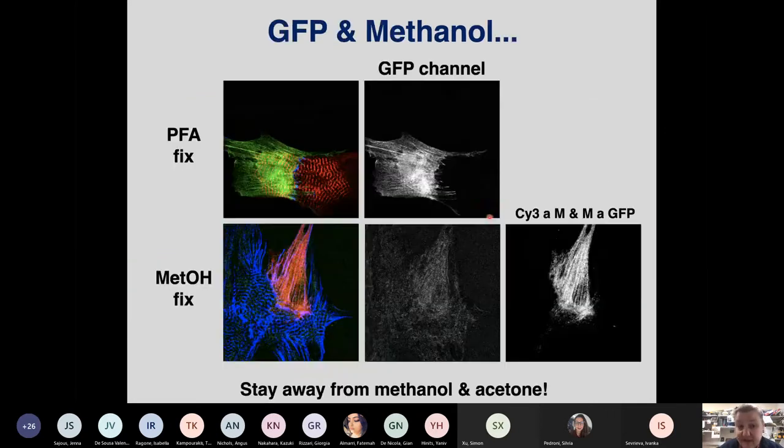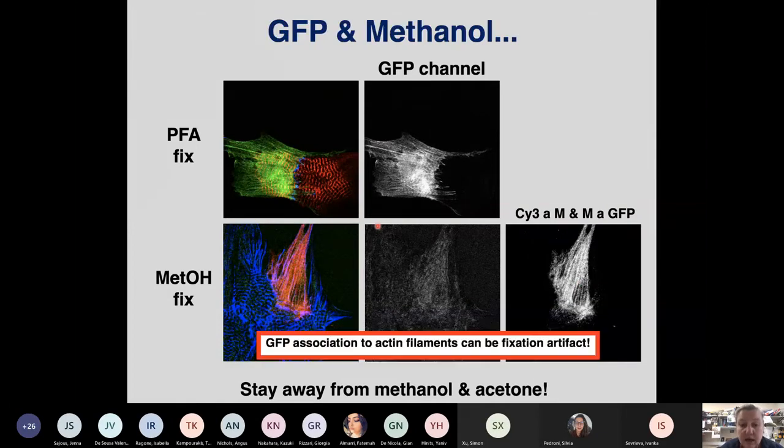But while I'm always keen on booze, booze is not always good. For example, if you look at GFP transfected stuff, here we have examples of GFP transfected cardiomyocytes. PFA fixed, GFP channel, beautiful fluorescence, transfected cell. Methanol fixed, the GFP fluorescence is almost gone. But the GFP is still there, because if you use a primary antibody that recognizes the GFP, it's fine. So we can visualize it, but GFP and methanol is not a great combination. And just to remind people that if you have stringy filamentous stuff with the GFP, that can be a fixation artifact. So that may not necessarily be true.